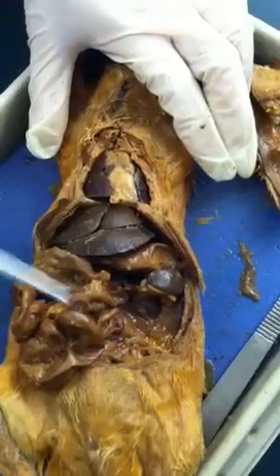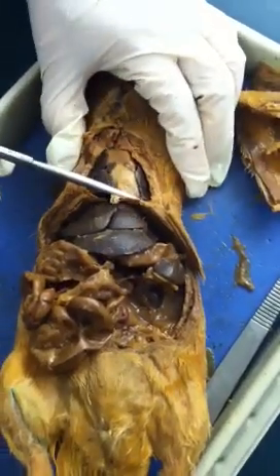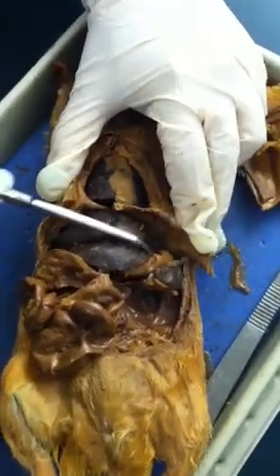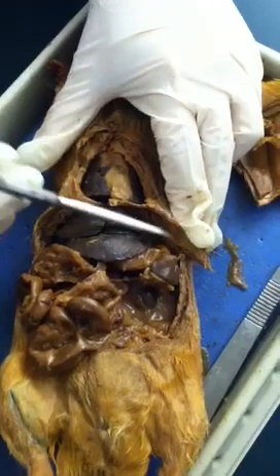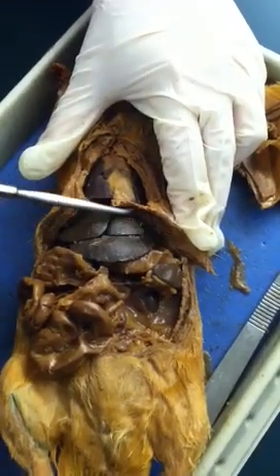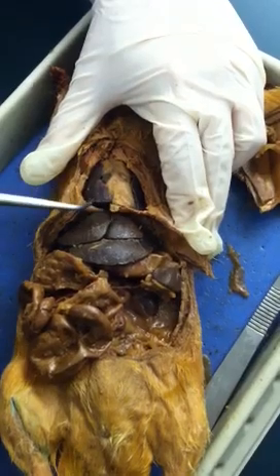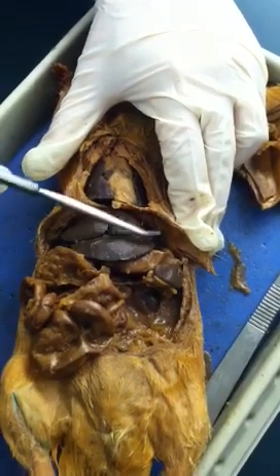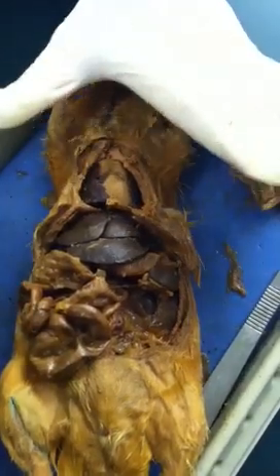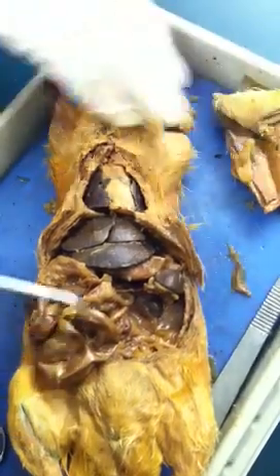So how would you know which one is which? You always find this muscular structure right here. It's in the middle of the two compartments — that will be the diaphragm. After you figure out where the diaphragm is, everything becomes easier because rats are mammals, so it's very similar to humans.